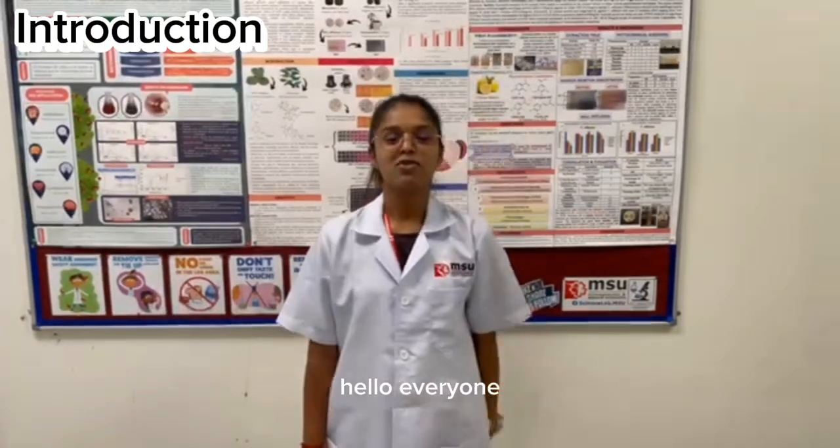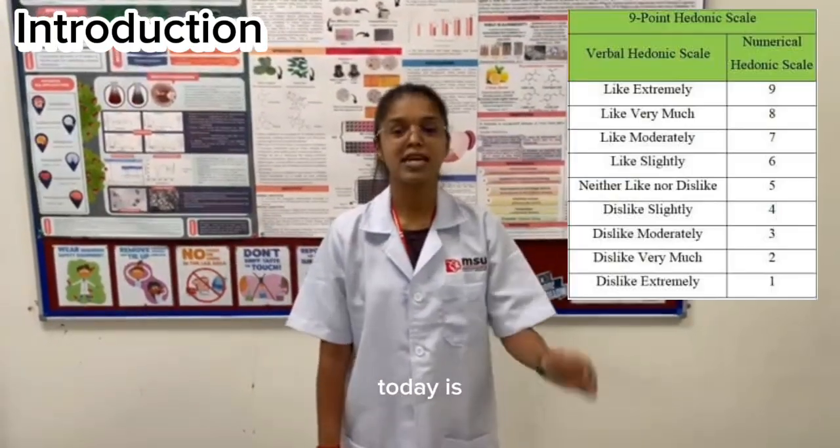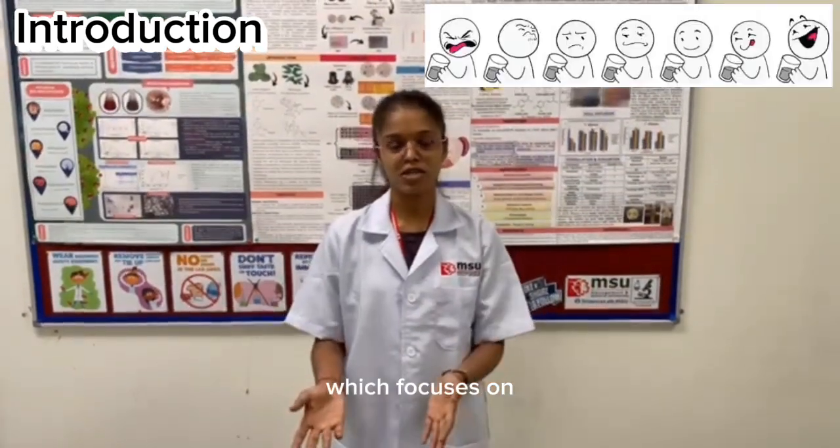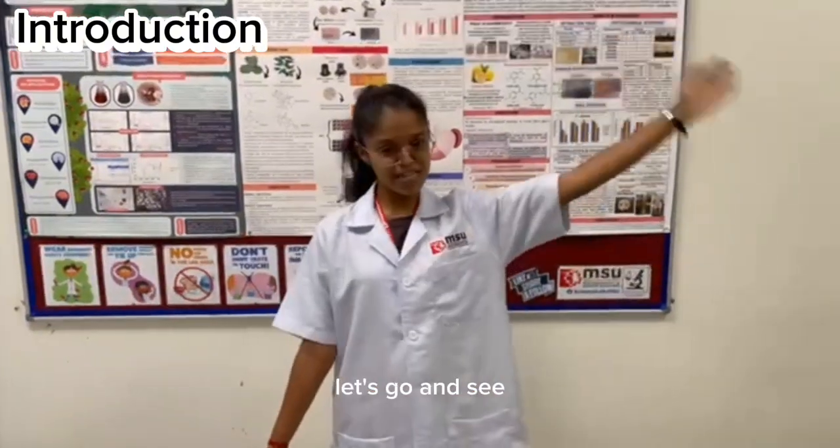Hello everyone, today we're going to conduct a sensory evaluation. The test we're going to conduct today is the hedonic test. A hedonic test is basically a preference test which focuses on assessing consumers' preference, likes or dislikes. Let's go and see.